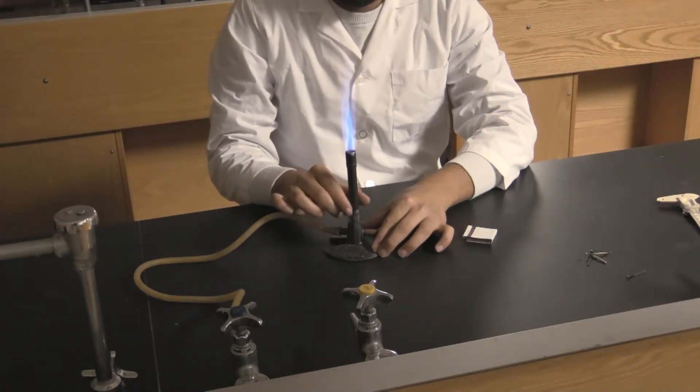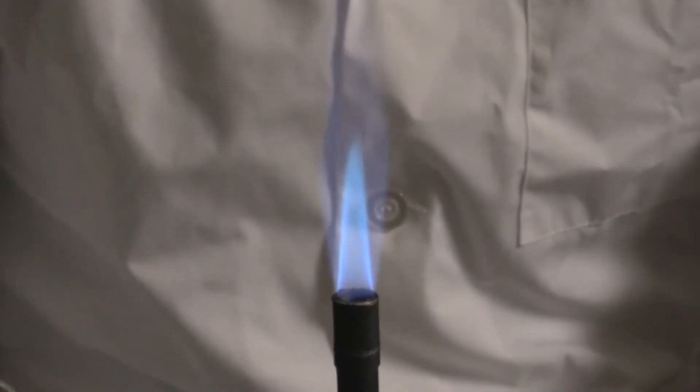Adjust your gas flow and air mixture until you have a flame with a nice blue cone in the center.